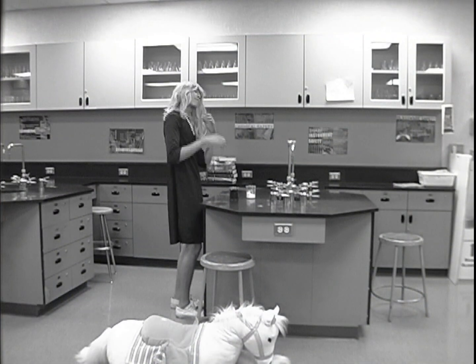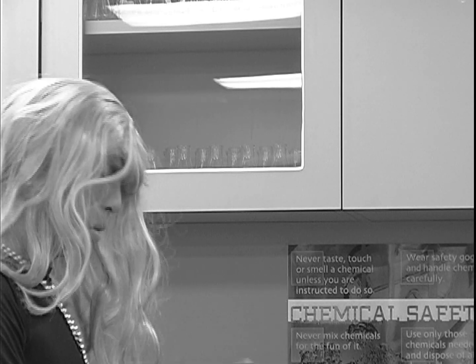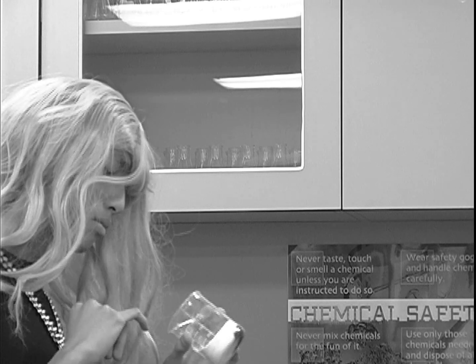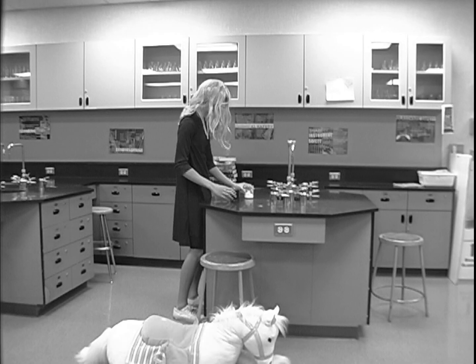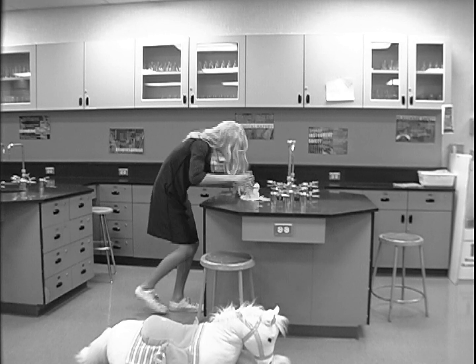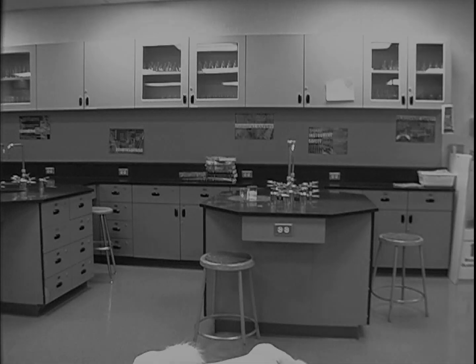Carol never wore goggles, or any of the correct laboratory apparel. Now she doesn't need them. Still, this tragedy could have been prevented if she only knew what the general laboratory safety rules were.